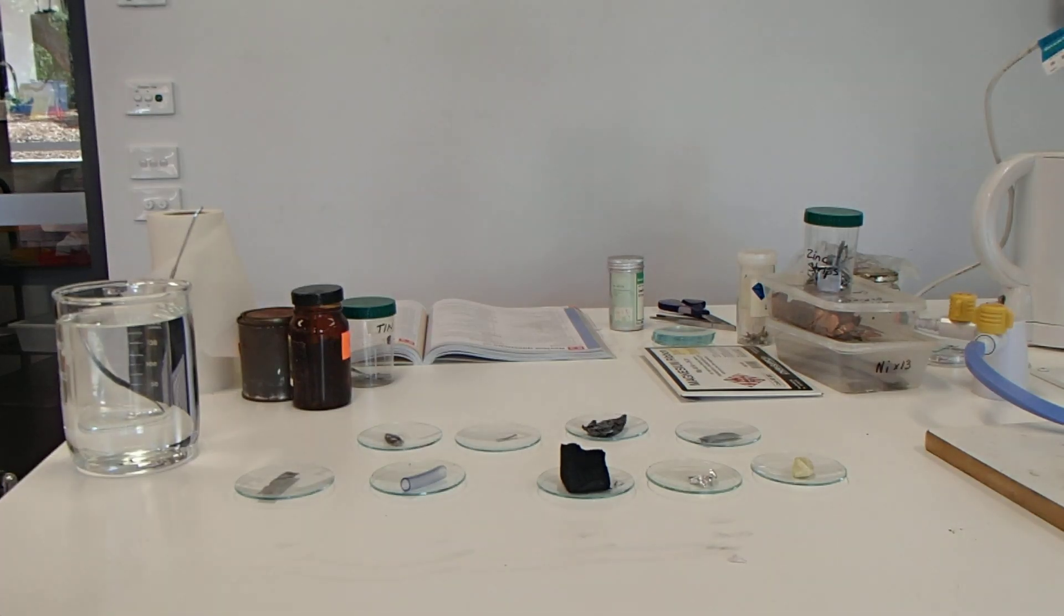So that's the first test for today, the appearance of the sample. Coming up next will be looking at the polished samples.